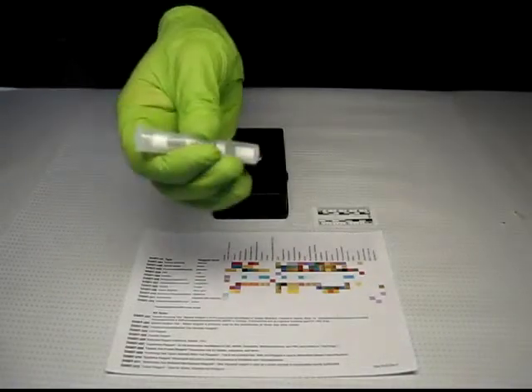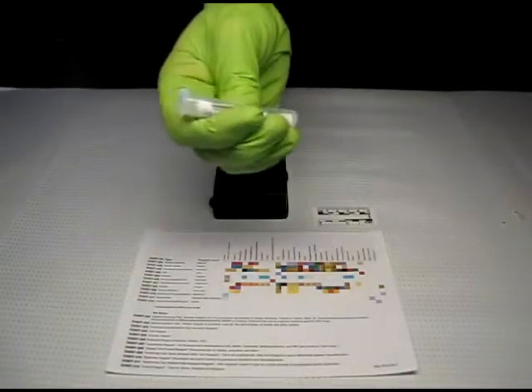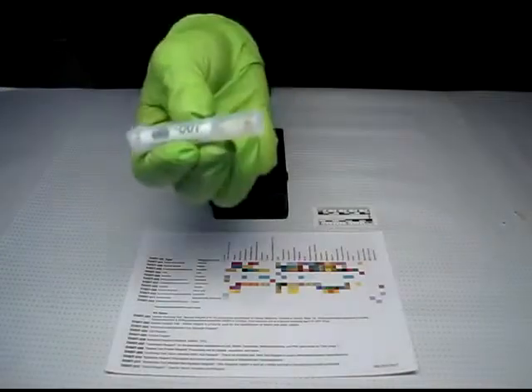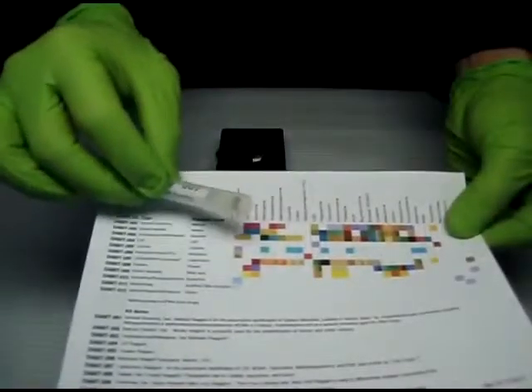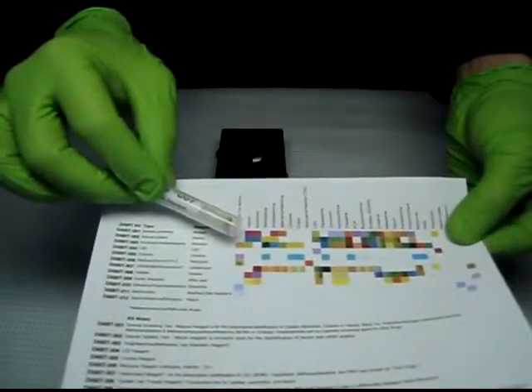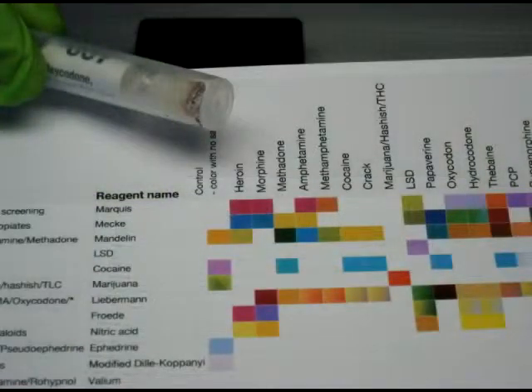Look for a color change on the sampler tip. Consult with the color chart. In this case, the color closely matches oxycodone. Refer to the instructions to verify these steps and the results.